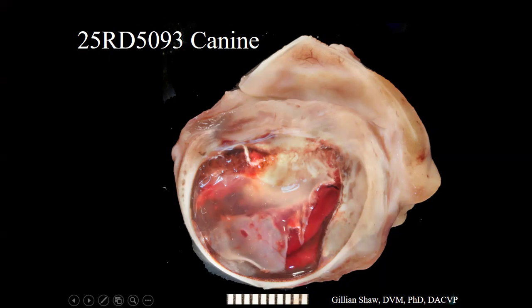Alrighty. Next up, we have an eye from a 12-year-old mixed breed dog, spayed female. The history we got was ventrolateral large uveal mass with partial retinal detachment, 2+ flare, and secondary glaucoma, chemosis, and hyperemia. I'll save the rest of the history for later.